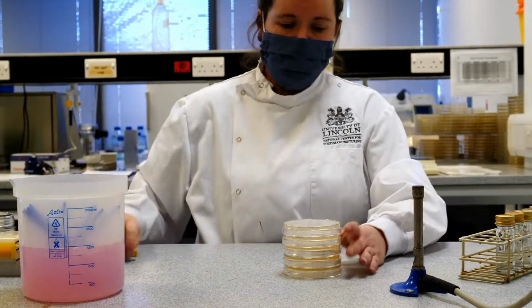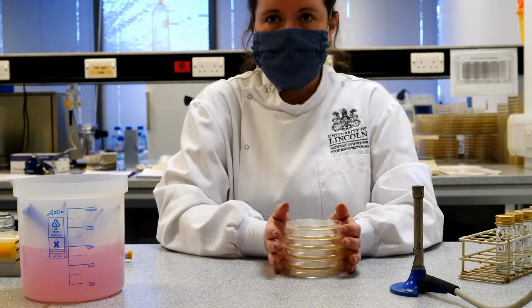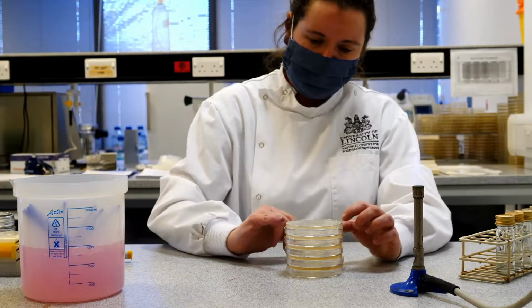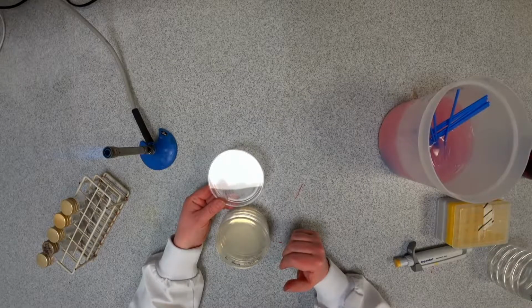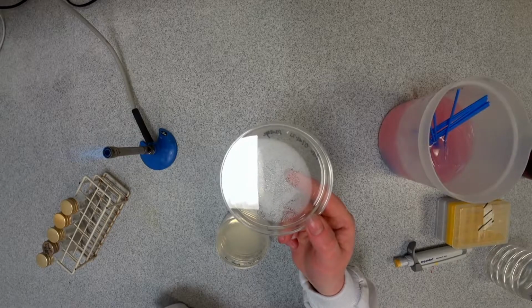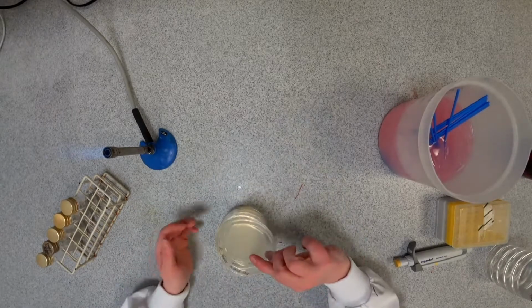Now, what's going to be important with this when we go in for incubation is that we put the plates so that the agar is at the top. And that's really important because the plates will get warm. We'll be incubating these at about 30 degrees centigrade. And what will happen is that the plates will start to sweat a little bit, and obviously the microorganisms as well will respire. And if we have the plates the other way around, you can see actually already in this case, hopefully, if we switch it, good, you'll see there are some droplets of liquid on the surface. Is that better? Yeah? Some droplets of liquid on the surface of the lid. And if we leave it this way, those droplets will get bigger and then drop onto the surface of the agar, and that can cause our plates to look very messy after incubation.